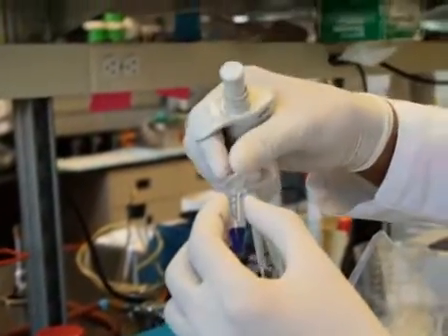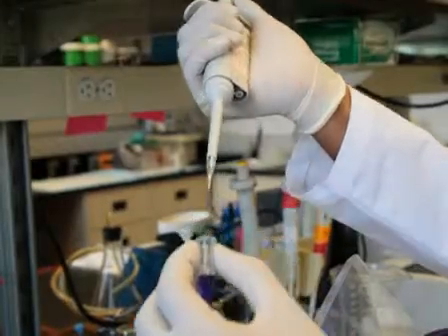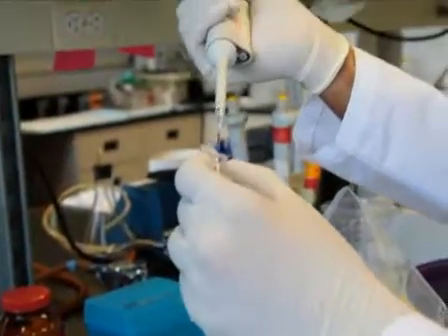Upon completion of either the peroxidative or oxidative reaction, dissolve the dried RNA pellets in 8 microliters of gel loading dye 2.